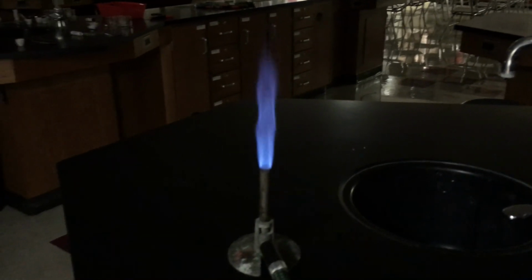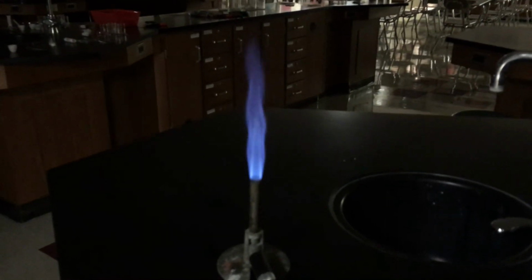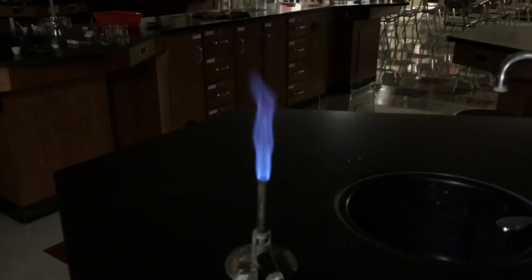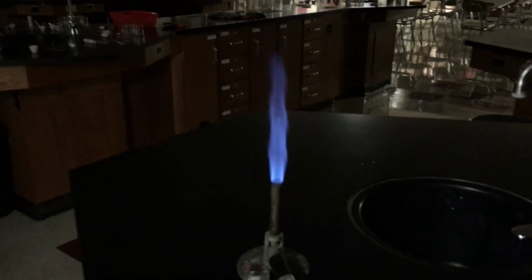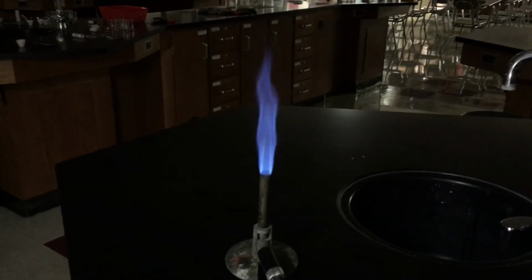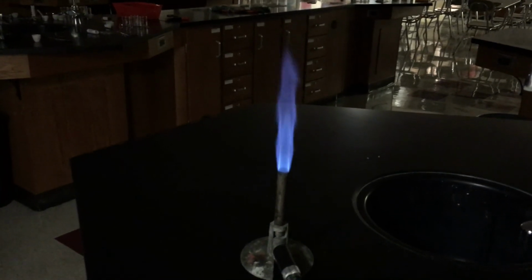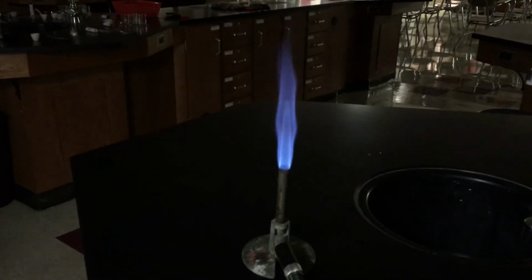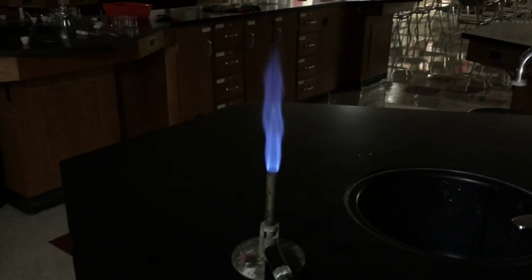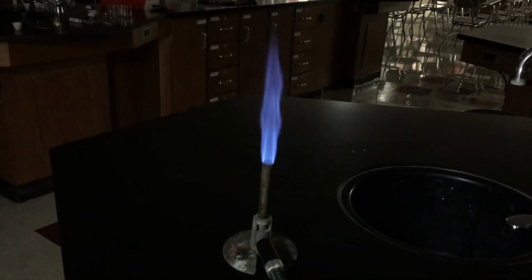The color of light can tell us something about how far the electrons are going through the electron cloud. A bigger jump requires more energy, which means we're going to end up releasing more energy when our electron goes from the excited state to the ground state, when it de-excites back to its normal place in the electron cloud. A bigger jump that requires more energy is going to release more energy, which shows up farther down the rainbow in terms of visible light, closer to blue or violet rather than red or orange, which would be a lower energy jump.